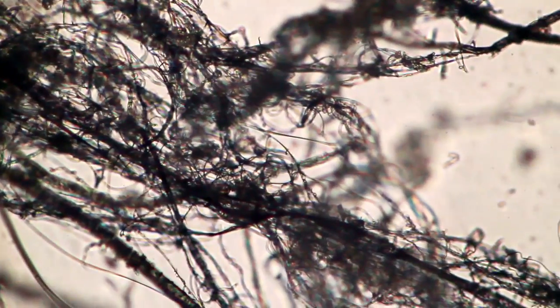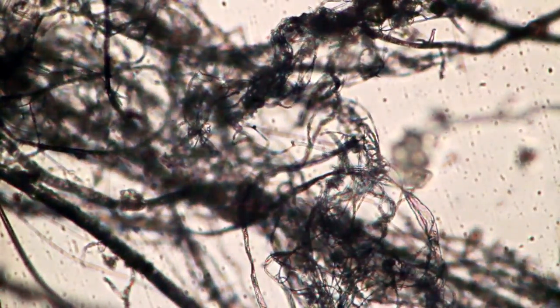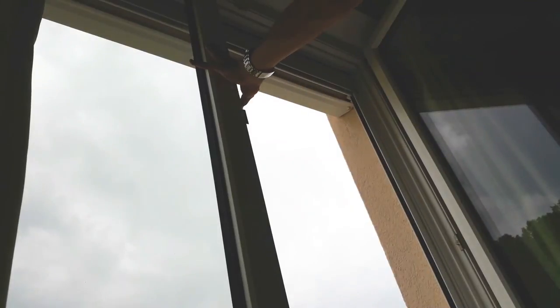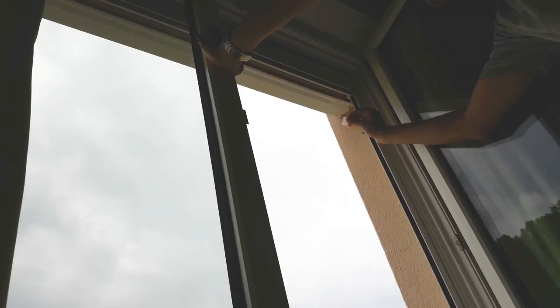I don't even know where the spider's silk is, so I decided it's not going to work. This was a complete fail. For this reason I was looking for a fresh spider's web, one that is not covered in dust. On my window I was actually very successful. Unfortunately the spider had to sacrifice its web, but the result was quite good and satisfactory.